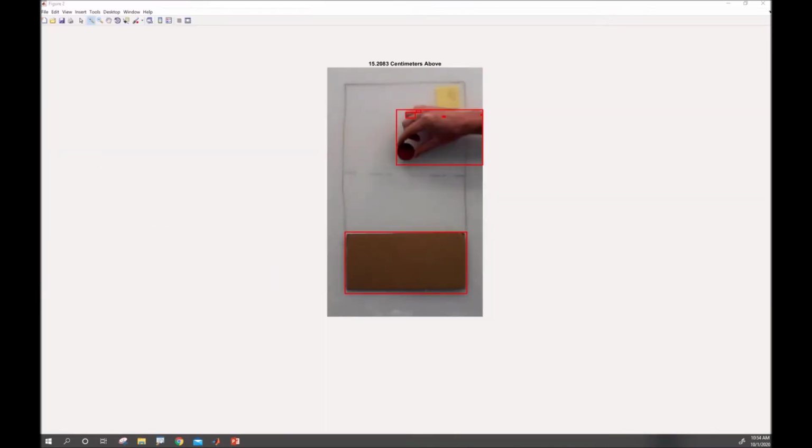An additional fun thing we can do is put the code within a loop so it will update in real time and show the location of that dot as it moves throughout the image. Have fun with it.